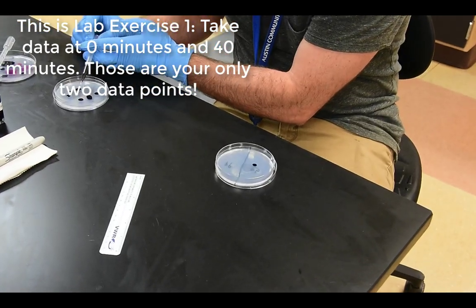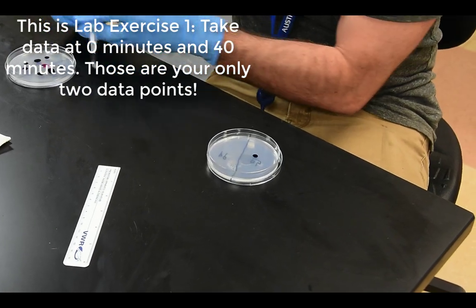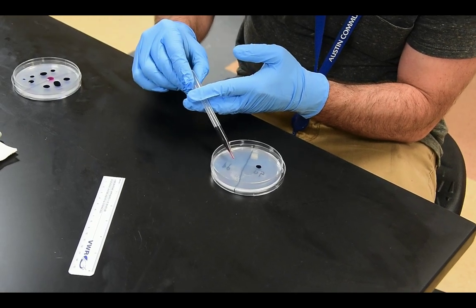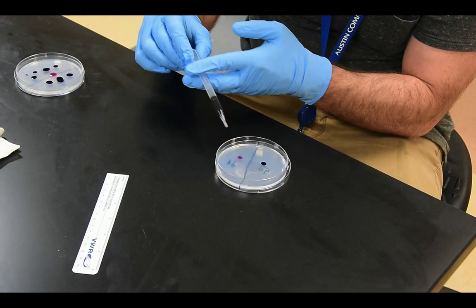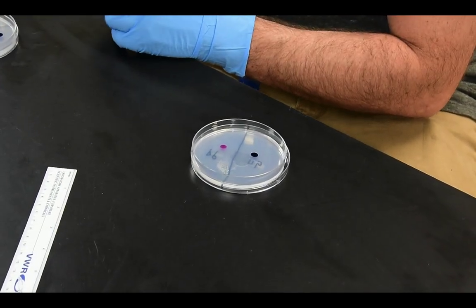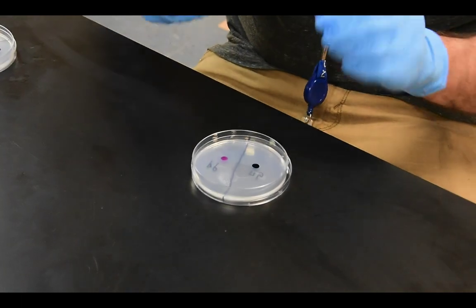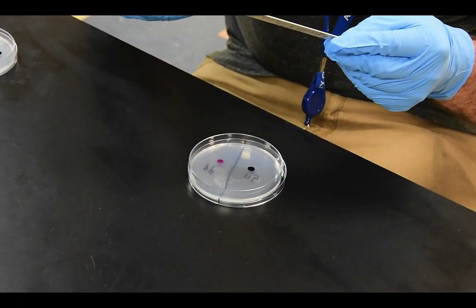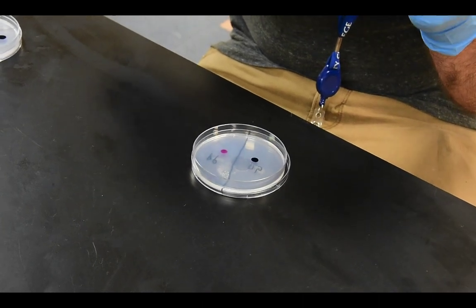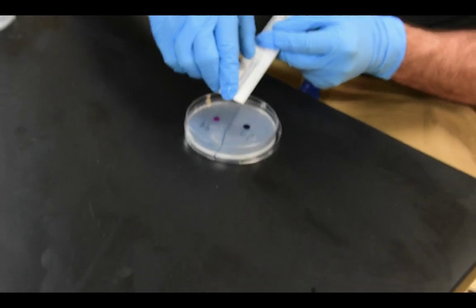So I may even take this over here and get a little bit of a flow going, and then I'm going to try and standardize the smallest drop of potassium permanganate I can possibly get. Now those two dots are relatively equal, so what I'm going to do is measure them right off the bat. Now remember, we're measuring in millimeters, so pay attention to where it says inches, centimeters, and each one of those little lines in between the centimeter marks are millimeters.